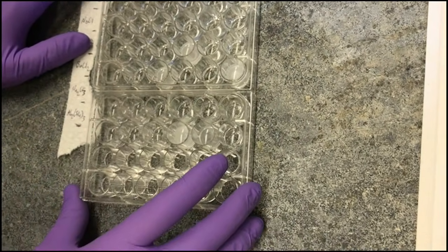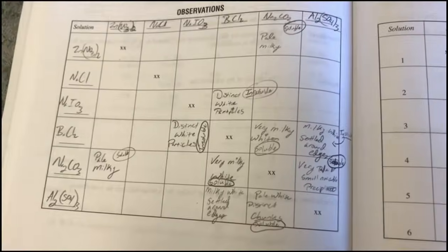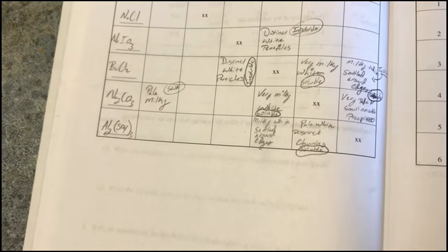All right, we're going to let them stand for about 2-3 minutes. Well, hopefully you left more space than I did on mine, because you remembered that we were going to have a second stack. So let's have a look here.